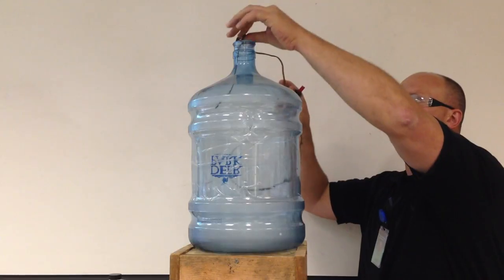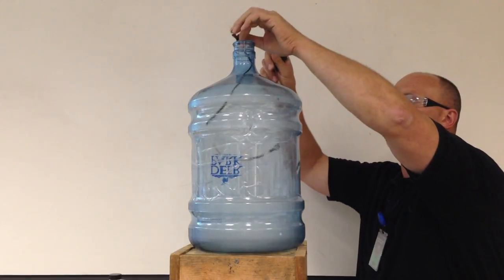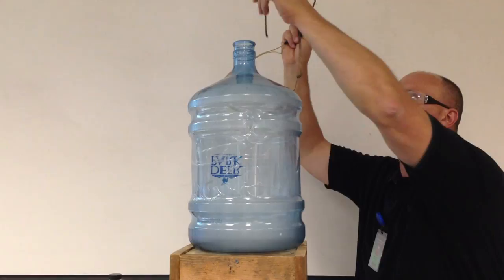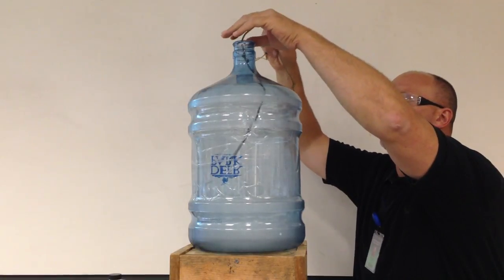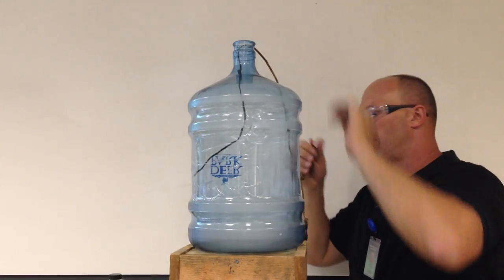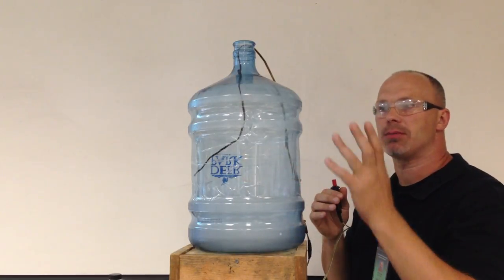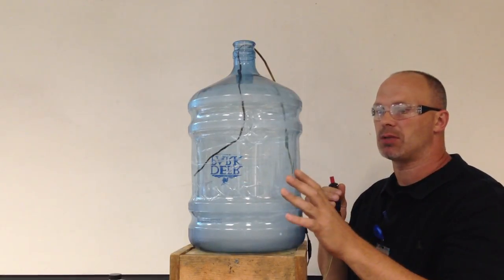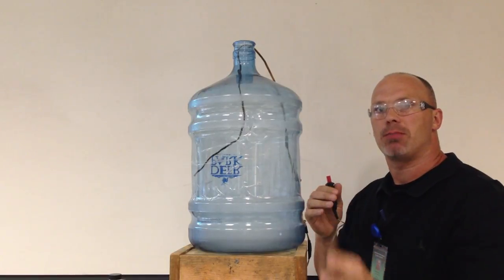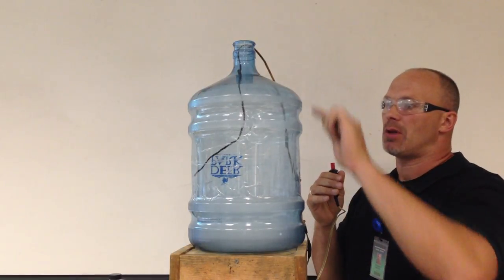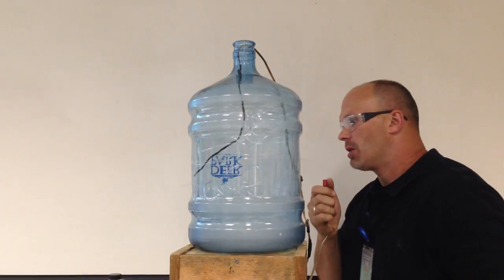And my hope is to react the oxygen with the alcohol. Now, I've taped this with clear tape because sometimes, one out of a hundred, sometimes these actually will explode. So, this could be a dangerous result. So, I've definitely taped it to make things safer. So, here we go.